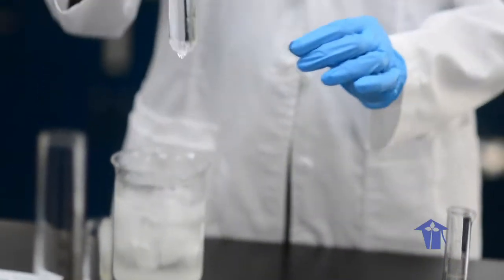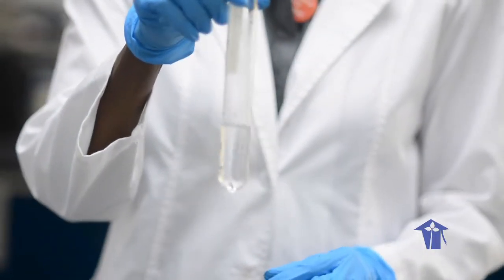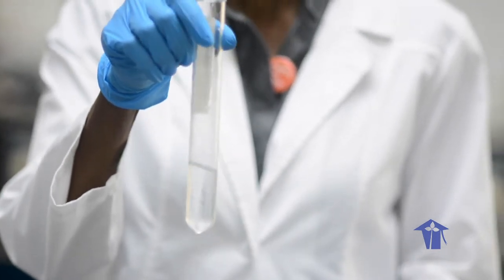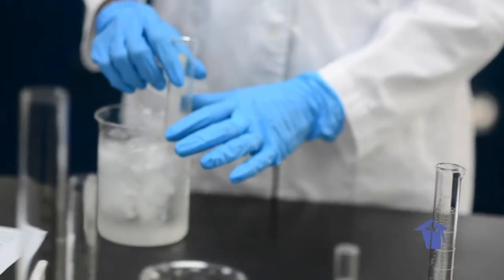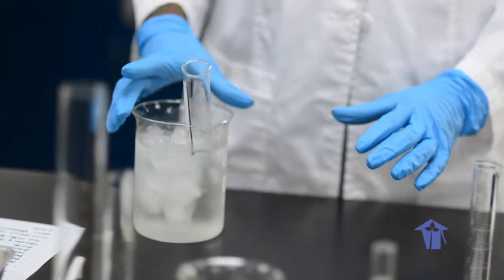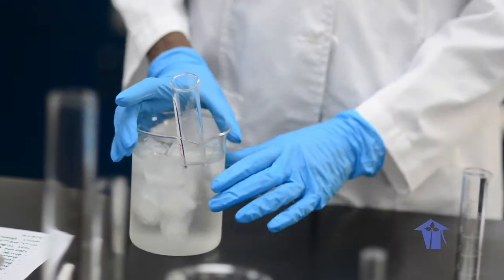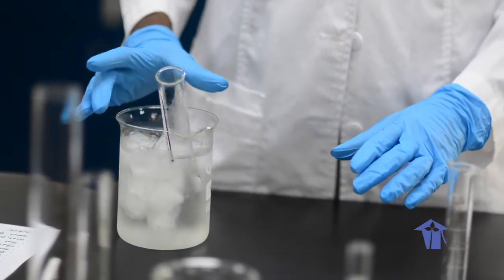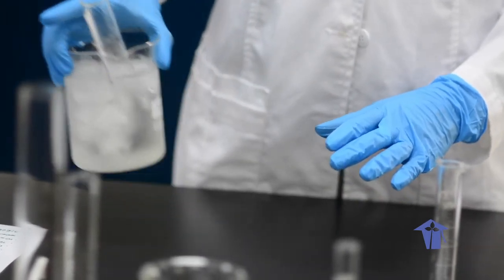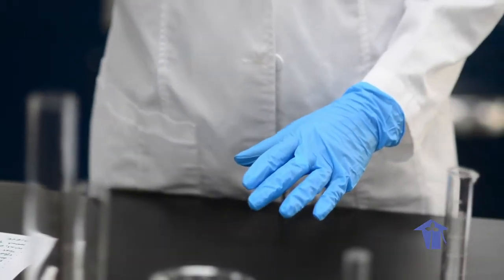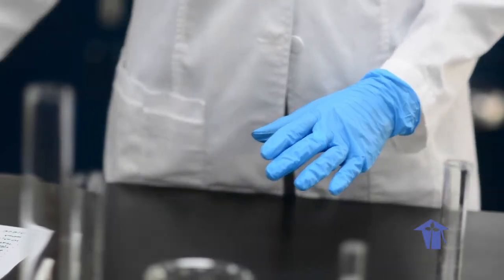I have measured the appropriate amount of alcohol into this large boiling tube. And I am now going to store it in an ice bath which can be simply a large container filled with ice. It is very important that you keep the alcohol cold, so we are setting this aside until we need this for another step.